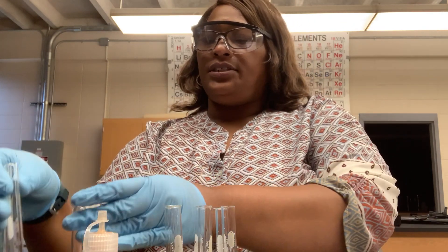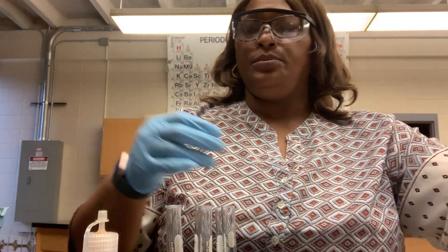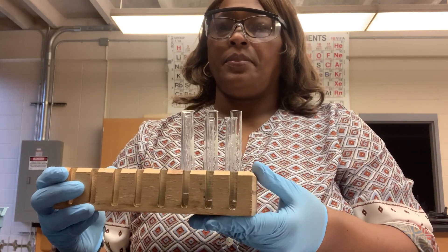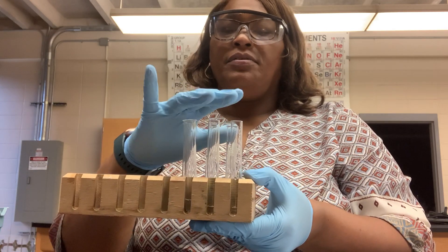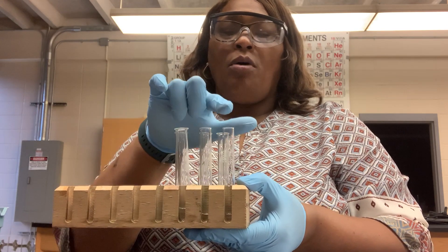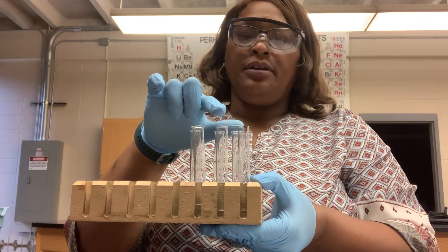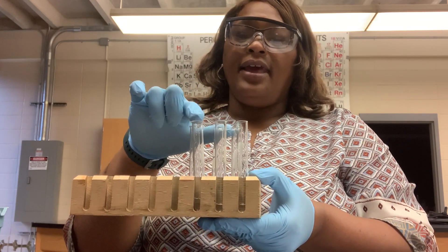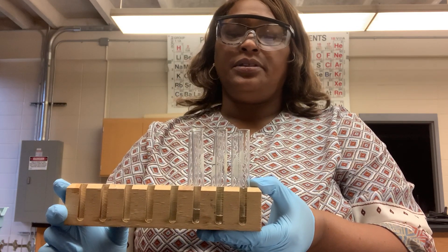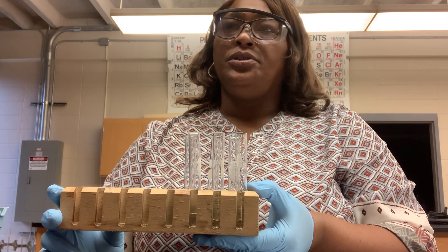I have a set of test tubes — six total, arranged in two rows of three. In each row, I have tap water, ammonia, and club soda. I'm going to test each of these three liquids for pH by using each of those two indicators.